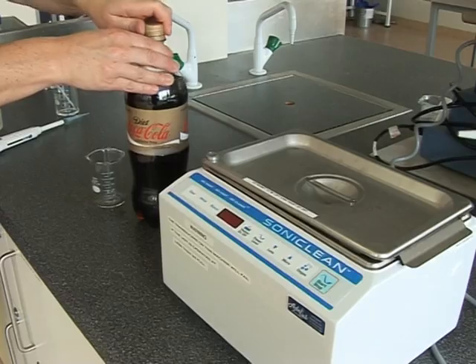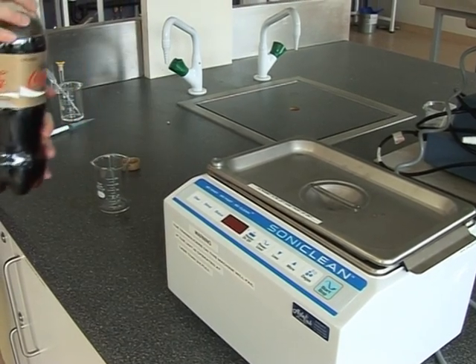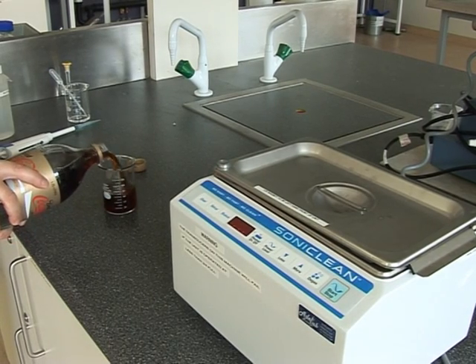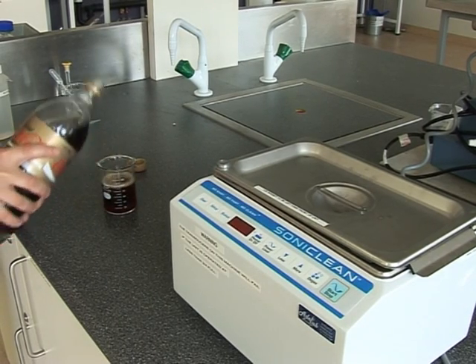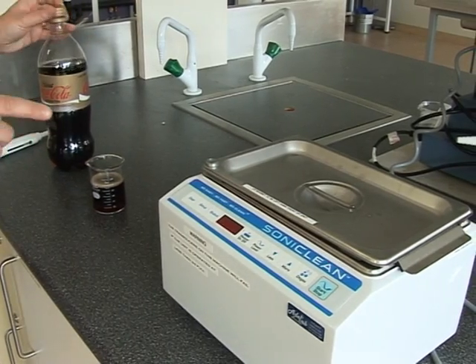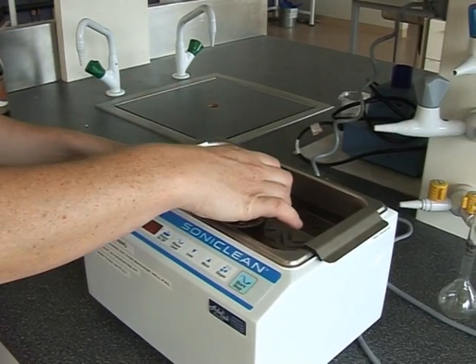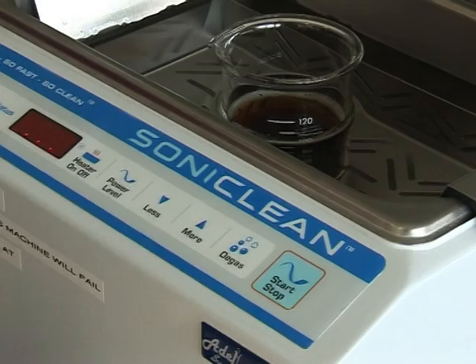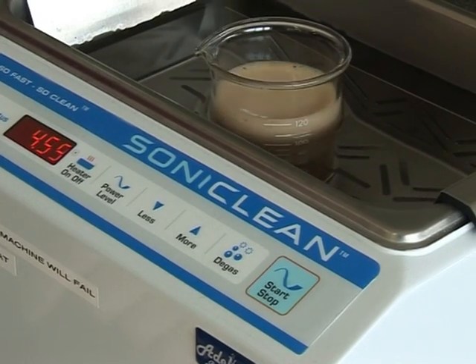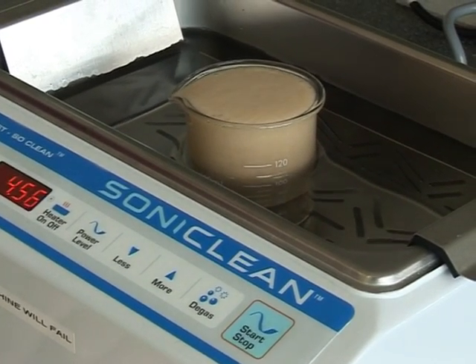Next, you need to prepare your soft drink samples. Pour some soft drink into a beaker until approximately half full. Place the sample into a sonic bath and run the bath for one minute to degas the sample. If after one minute the sample still contains visible bubbles, run the bath again for one minute and proceed to do this until all the bubbles have been removed.